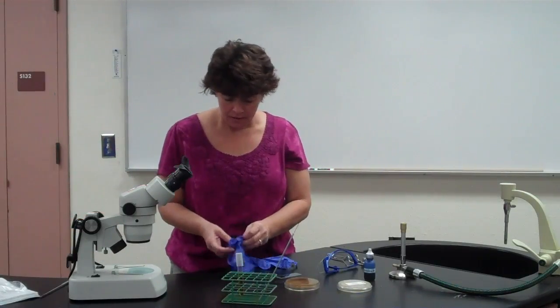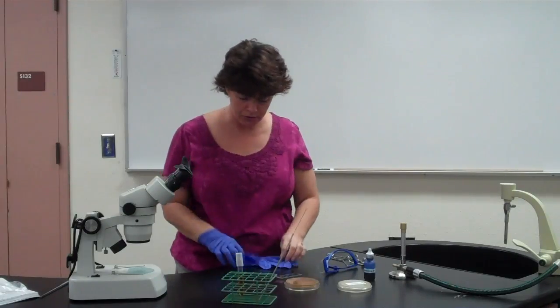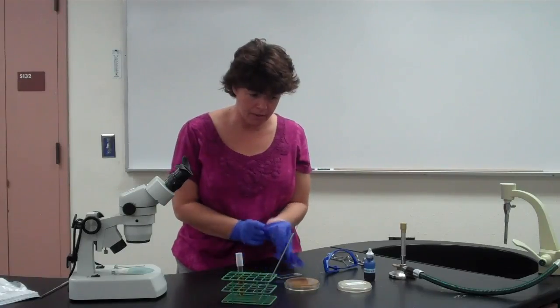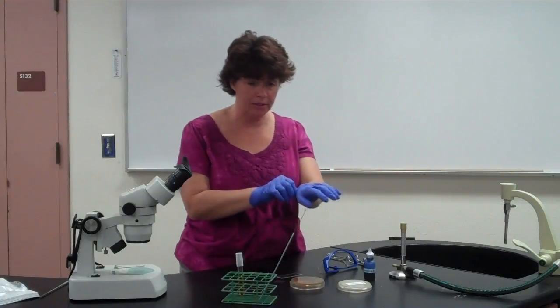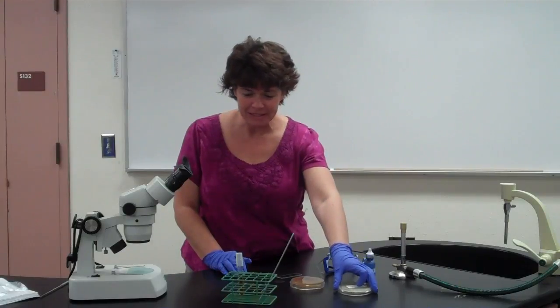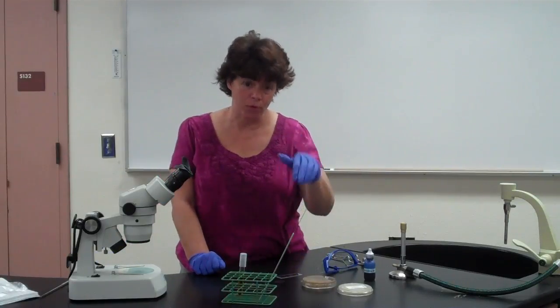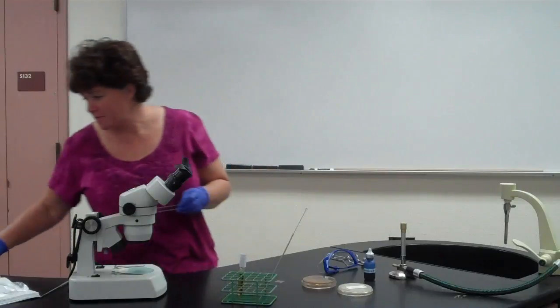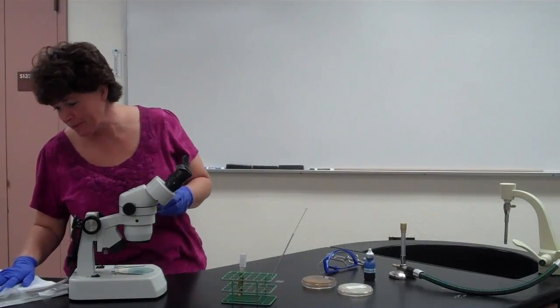Okay? Now, for this lab, the 3 things that you're going to be doing are looking at them on the plate, looking at them under the microscope, and also looking at them after they've grown for a week. So let me rephrase that. The first day you'll look at the regular plate, and possibly even in the tube you could look at it under the magnifier. And then after you have put them on this plate and grown them for a week, then you're going to look at them microscopically. Lab 2, make wet mount.